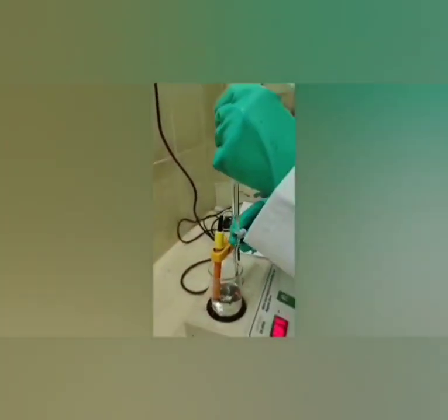After reaching the end point, there is an increase in conductance values. Before the end point, there is a decrease in conductance values, and after the end point, we observe an increase in conductance values.